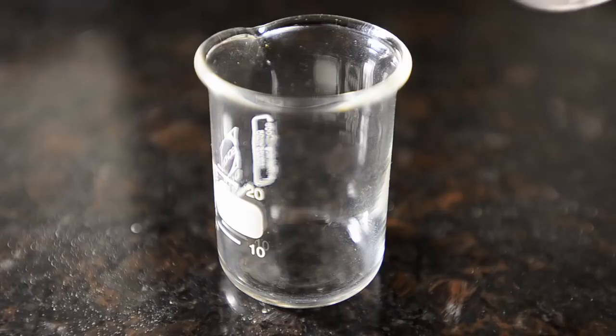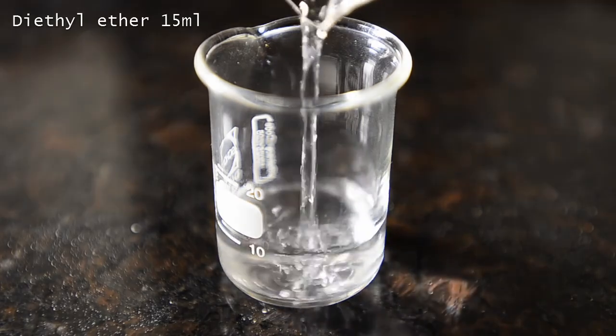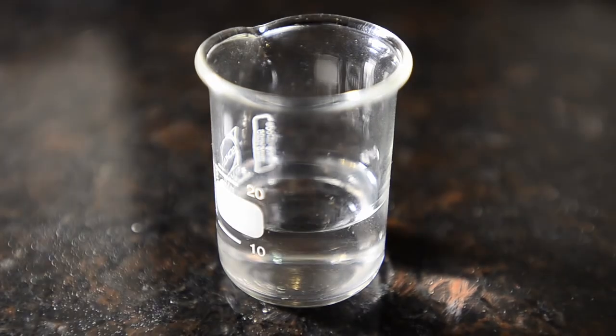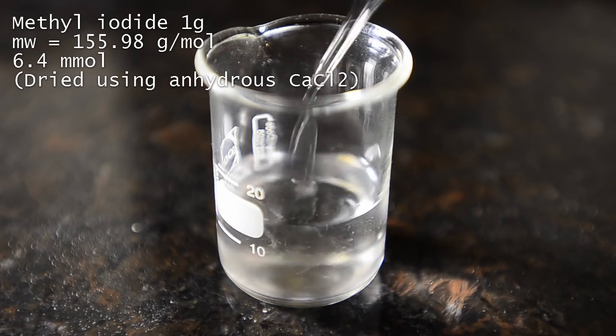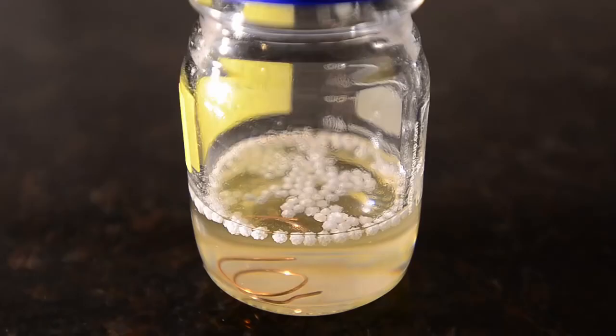We then measured out another 15 ml of ether into a small beaker which had been oven dried in the same way as the flask. We added 1 gram of methyl iodide to this. The methyl iodide was homemade and stored in a bottle containing some anhydrous calcium chloride. Notice how the calcium chloride granules float due to the high density of the methyl iodide.